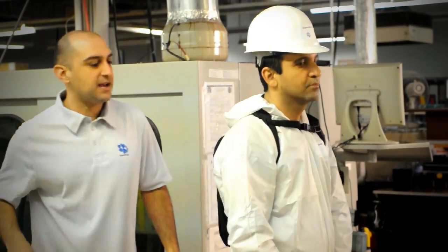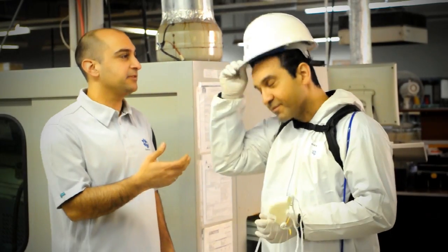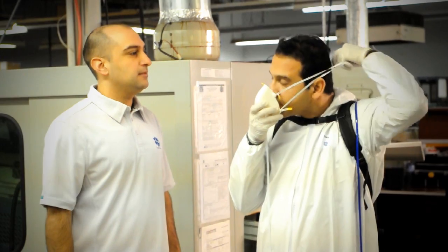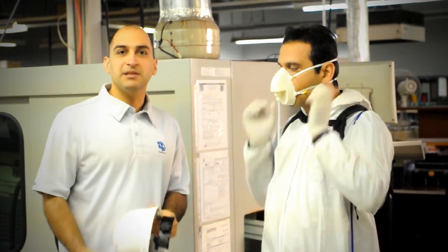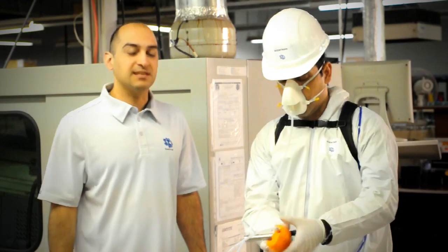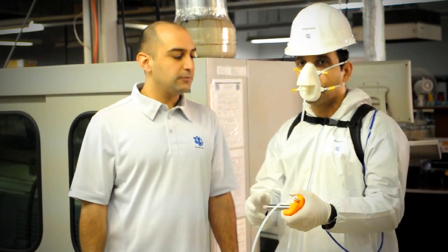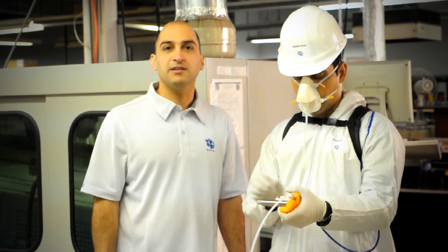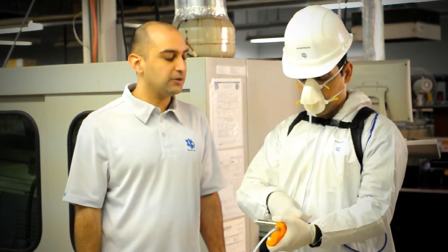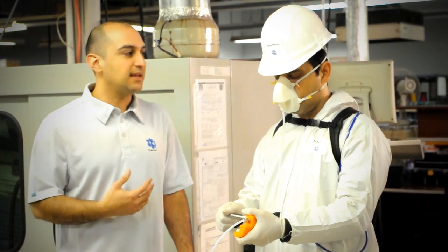Okay, and then Darius is going to put the mask on. Perfect. Now since we've been here for a few minutes, actually more than a few minutes, our nose might be desensitized to the smell that's here. So to get the full sensitivity back we're going to first purge Darius's nose with 30 seconds of fresh air. So he sets the dial to zero. He opens the valve and now you see that the fresh air is coming and he's going to really breathe that in and get sensitized again to the smell.